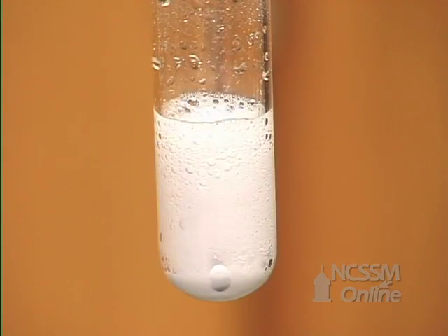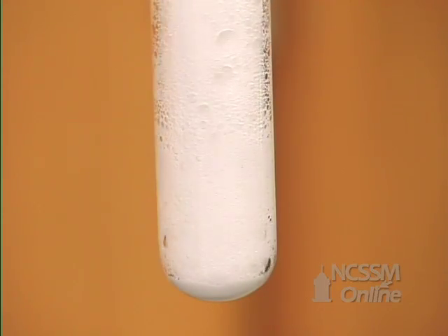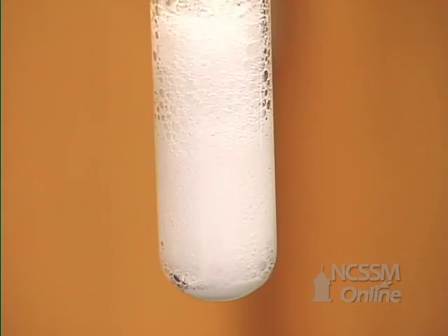The calcium chloride is water soluble, so we end up with a colorless aqueous solution of calcium chloride.